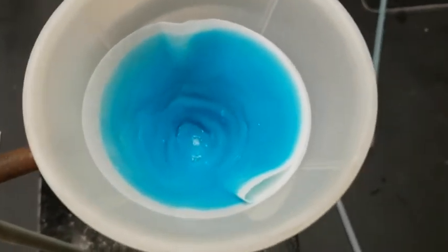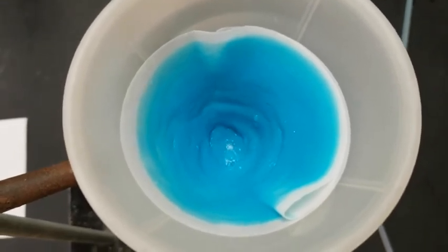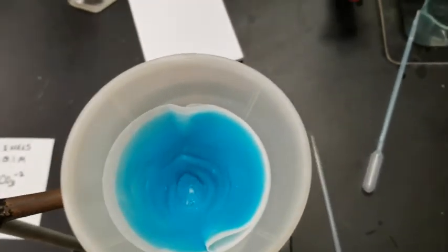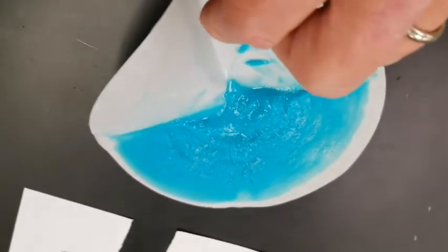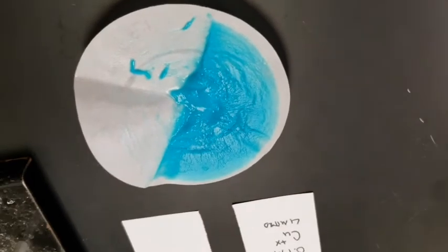That water is in there, and we've got to get that out of there in order to get an accurate reading of things. Now, we could just let it sit and evaporate, but it would be much faster if we were to give it a little extra help. So what I've done now is I've just gotten it out of there, and I have put it on a watch glass there, and that is going to let it evaporate even better.